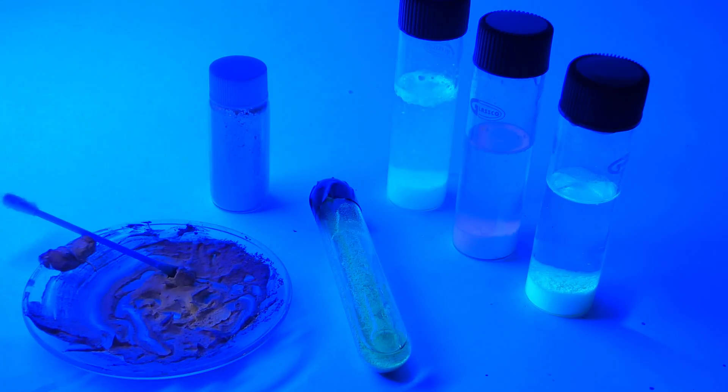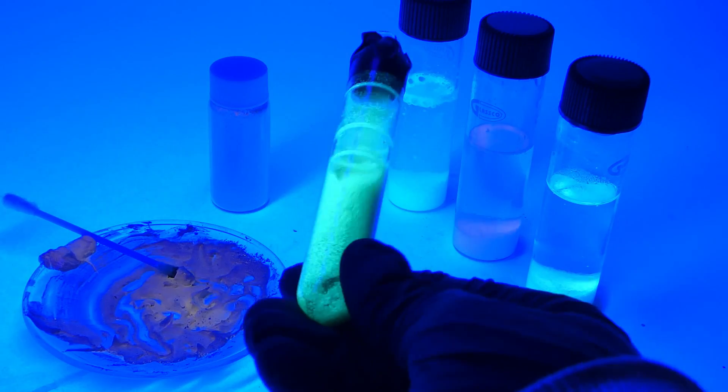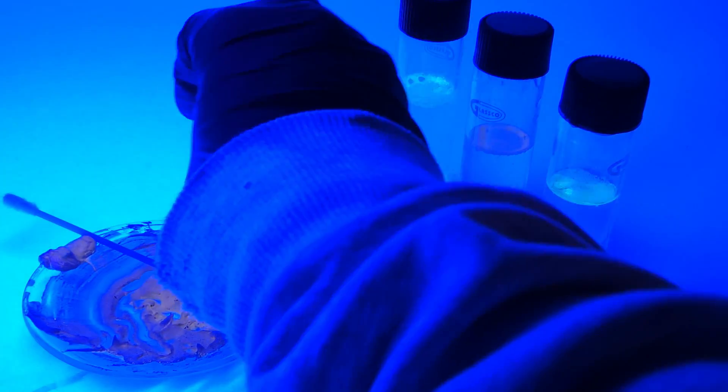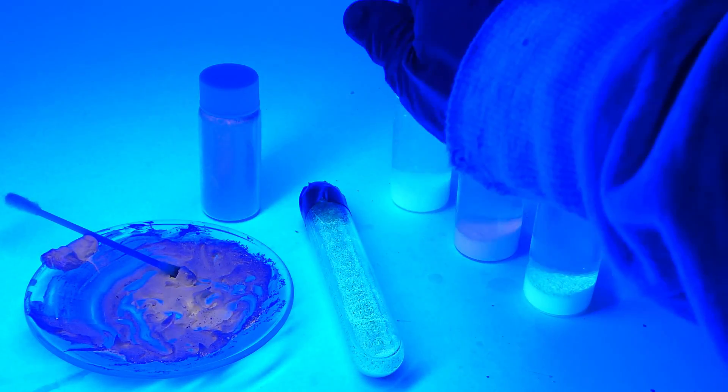After I was done with the whole project, I was now left with a pretty big collection of fluorescent things, which just looks amazing. I mean, there's nothing better for a chemist than some pretty colored compounds.